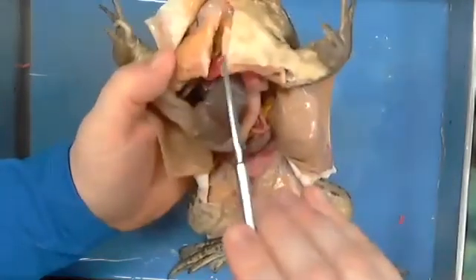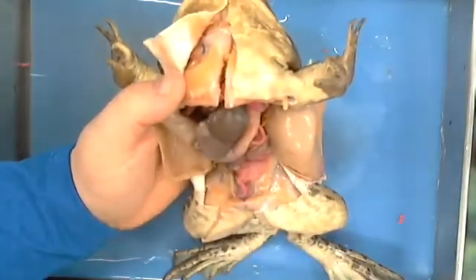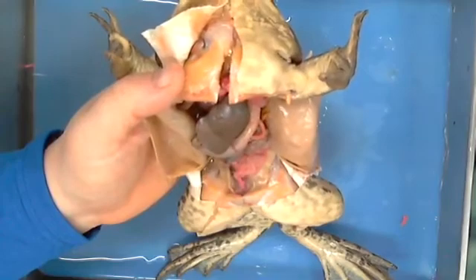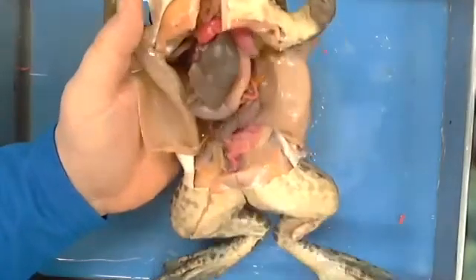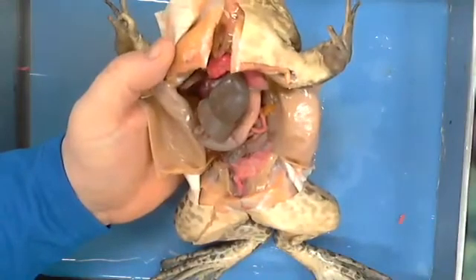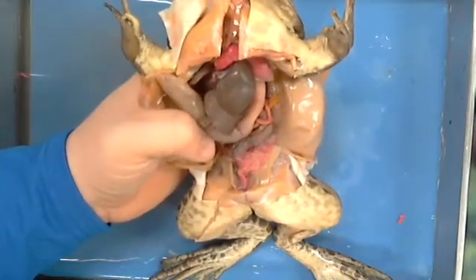even this up here, where I may ask you, why is this bone here, right? What's it called? This would be a rib cage. Why is it there? What does it say? To protect. That's exactly right. So that is the internal structure of a frog. Literally, if you were here, that's all you would have done was taken this apart and found all this. And then what we'd be doing is getting ready to pin good examples of all of these things, right?